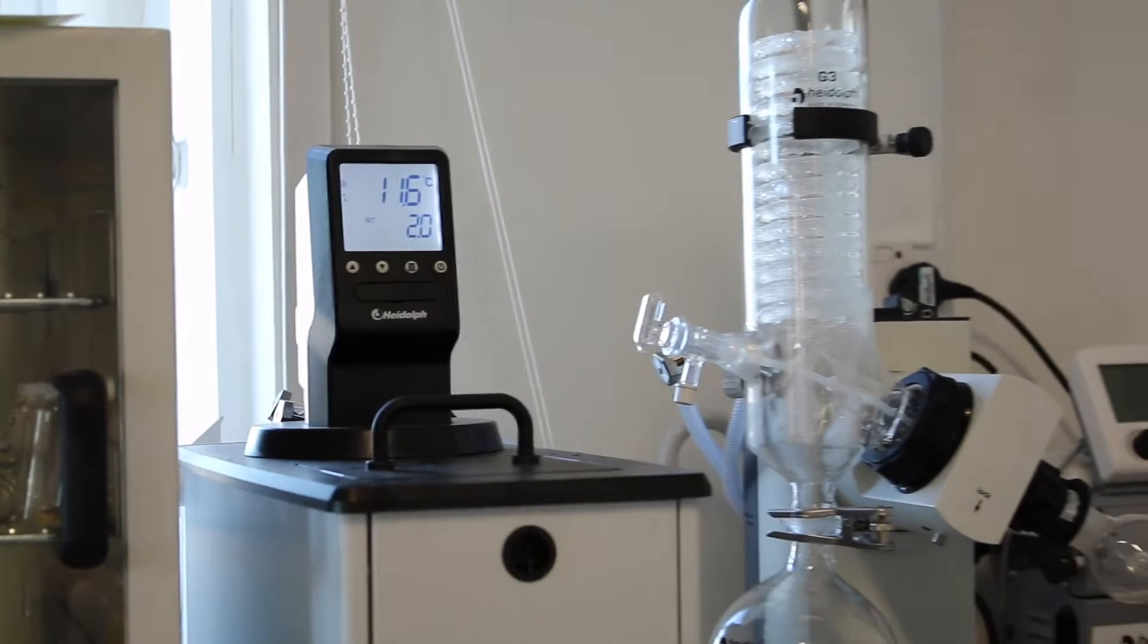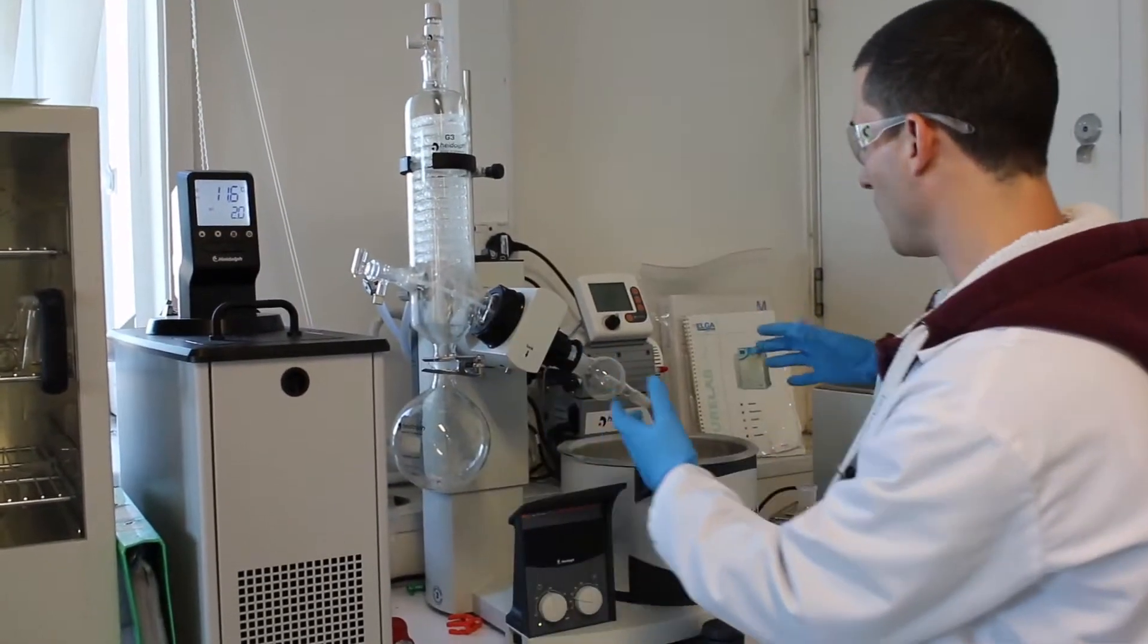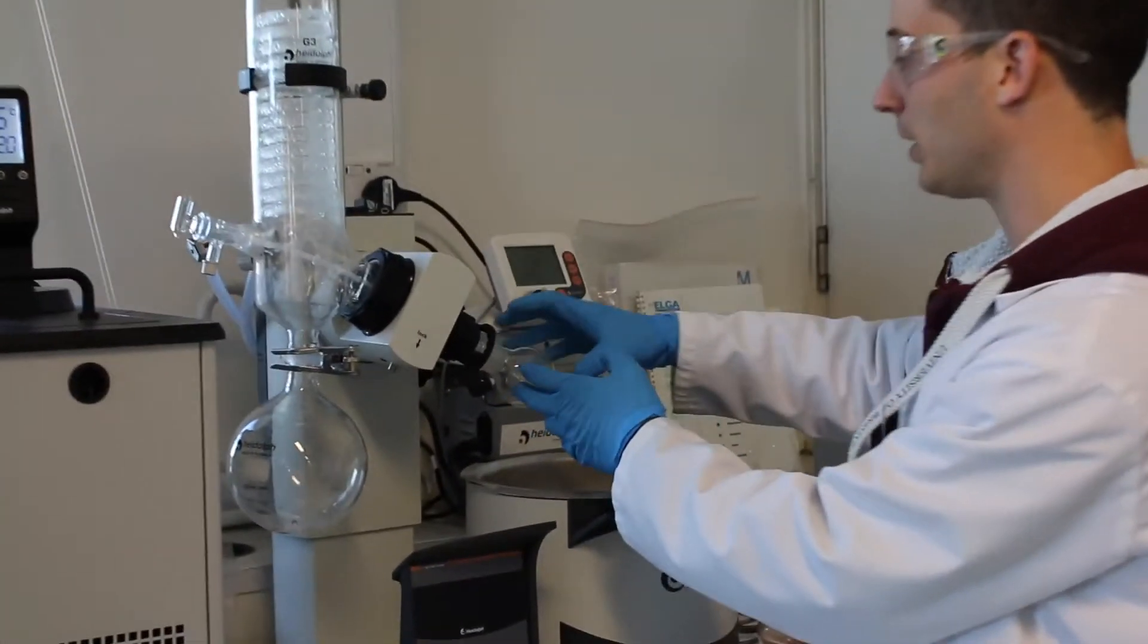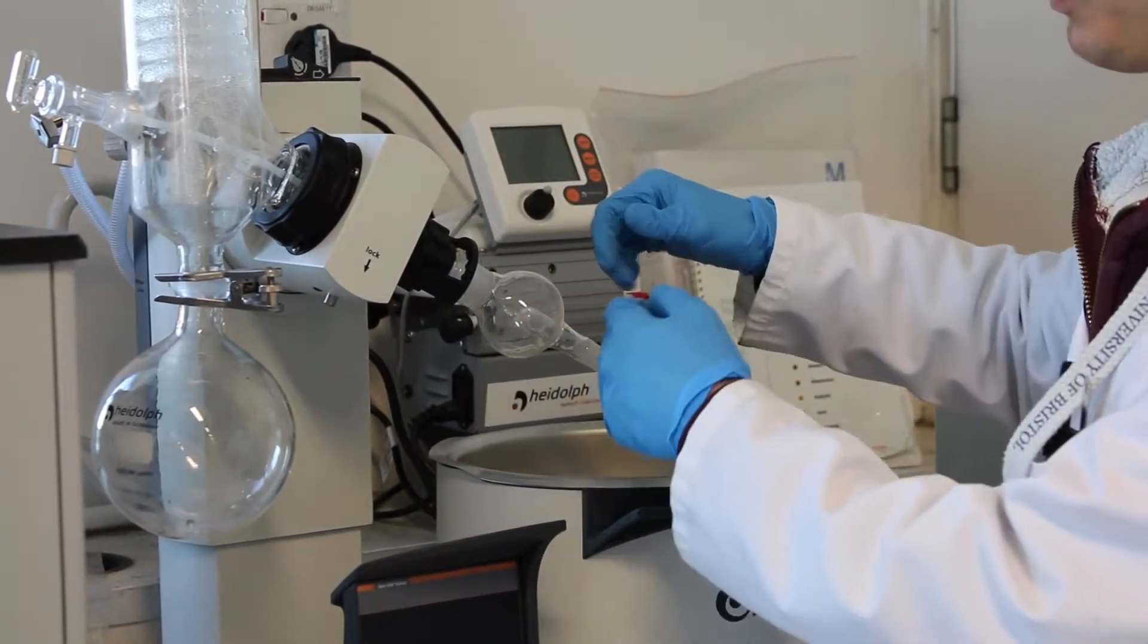Now I'm going to explain the setup quickly. This is the rotary evaporator, it's composed of a splash guard that will capture any solvent that might bump up because of the process.